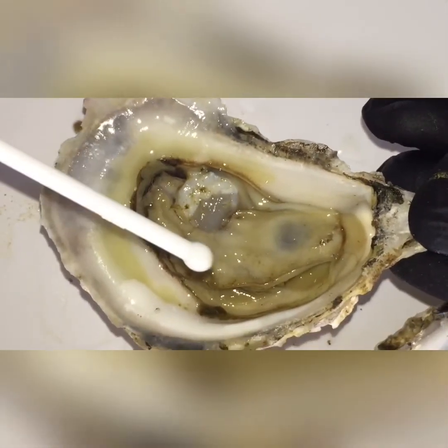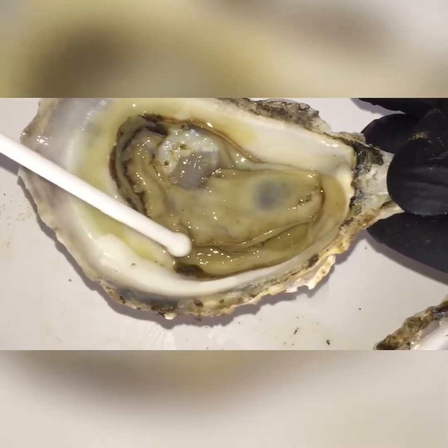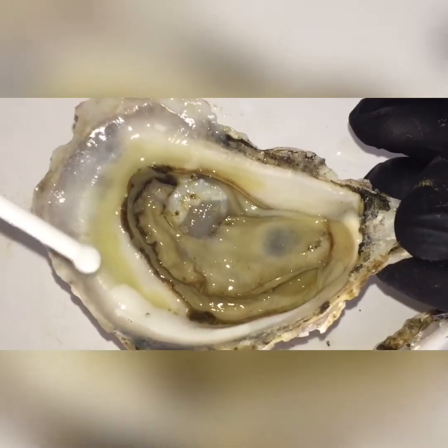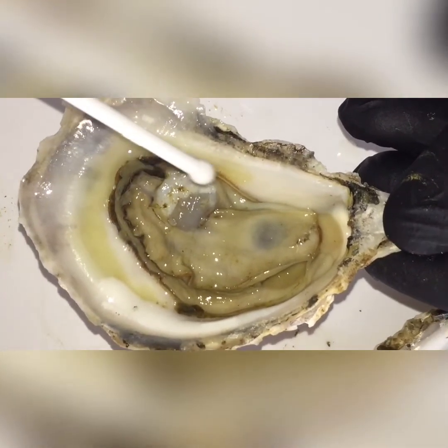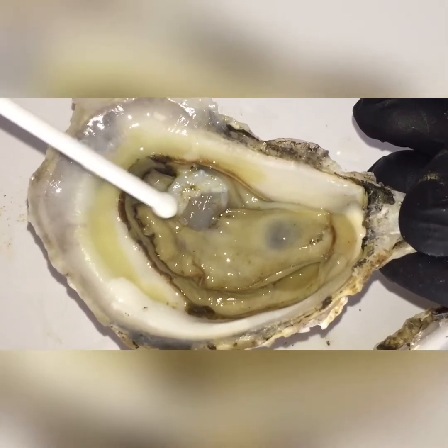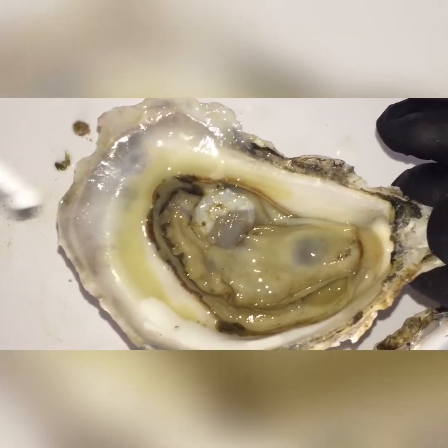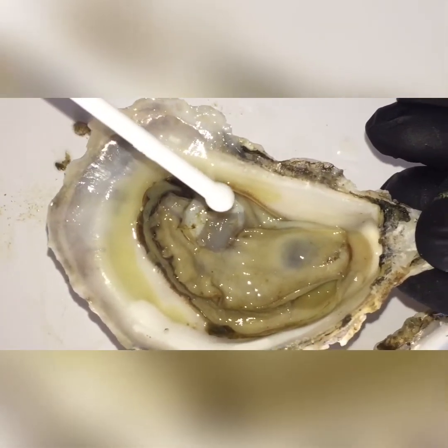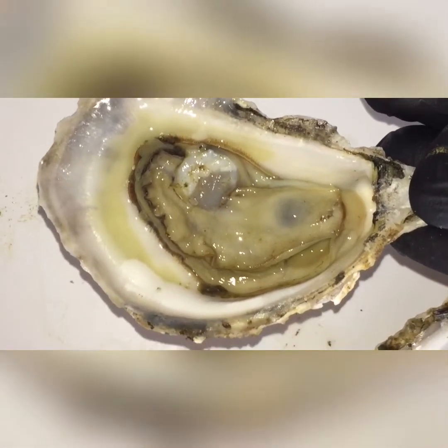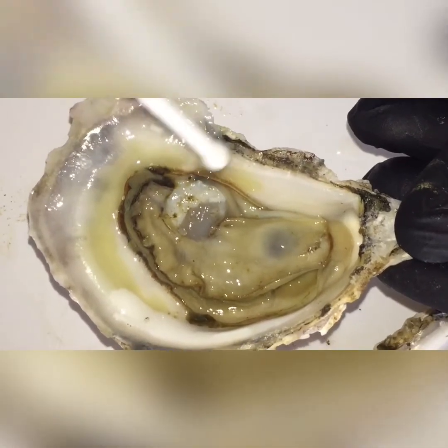So you're probably wondering: Marco, you also said that dirt goes into the oyster — so does the oyster eat dirt? And the answer is no, the oyster does not eat dirt. There's no nutritional value from the dirt. What happens is the oyster mixes the dirt in this thick mucus and it spits it out. And that is called pseudofeces, which means fake poop — because we know oysters actually do poop. So pseudofeces: fake poop.